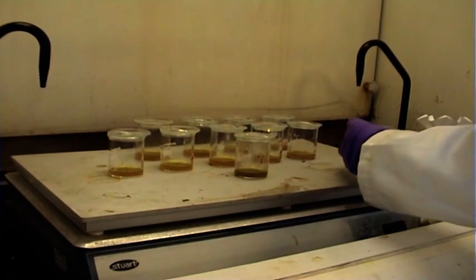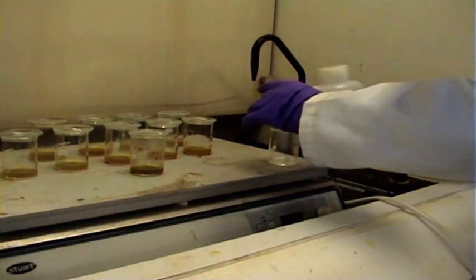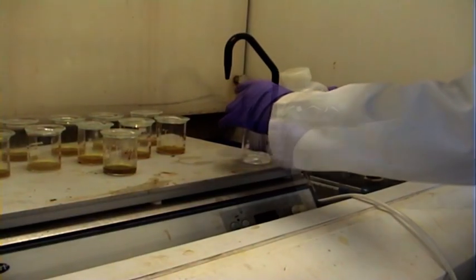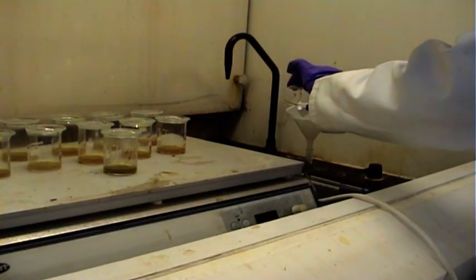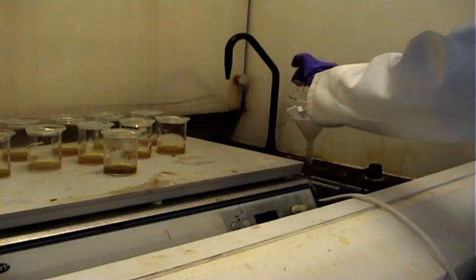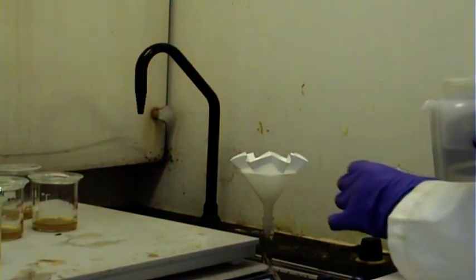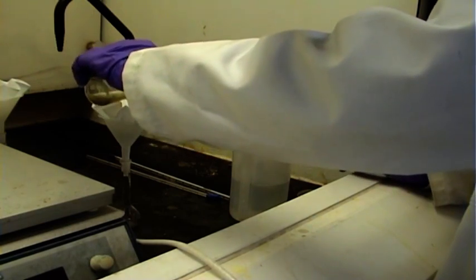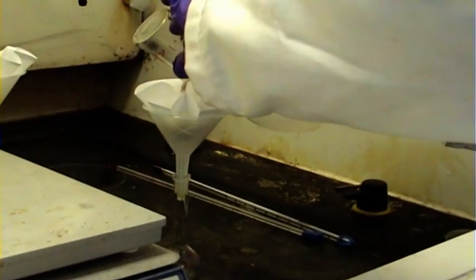Once cooled, the digested samples are diluted with ultra-pure water, then filtered into a volumetric flask, washing out the beaker's contents to remove all of the sample and rinsing with water or dilute acid. This is known as a quantitative transfer. This is repeated for all the sample digests. At the end of this process, the sample solutions are made up to the known volume and mixed by inversion.